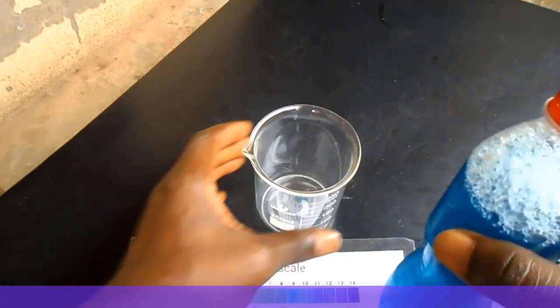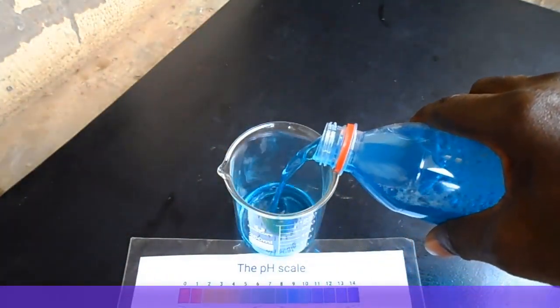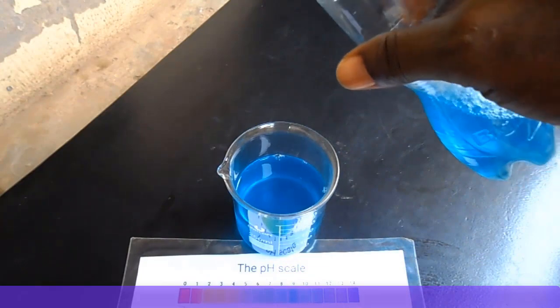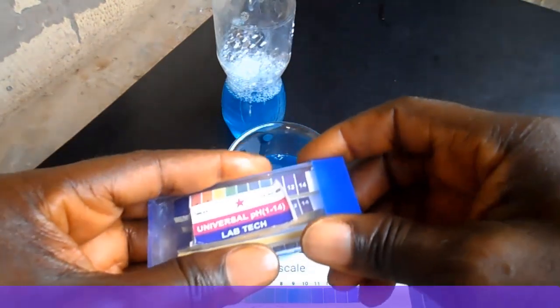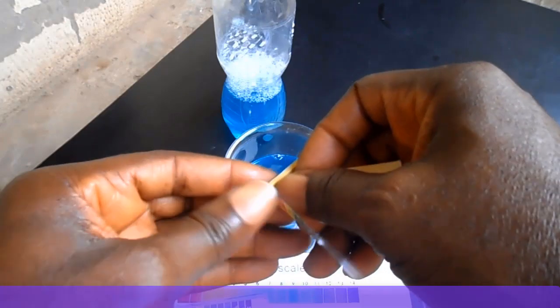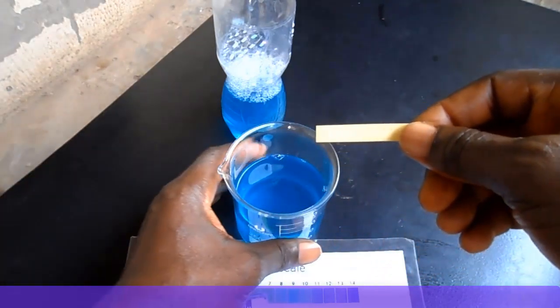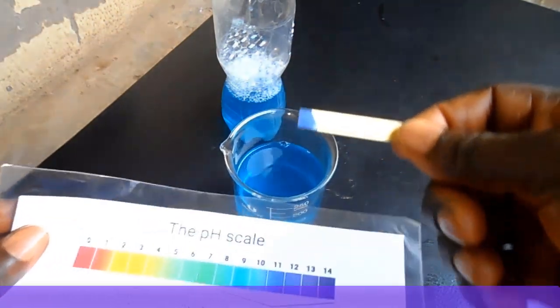Now pour some soap solution into a container. Bring out the universal pH paper and dip it into the soap solution. Now match the color of the pH paper with the color of the pH scale.